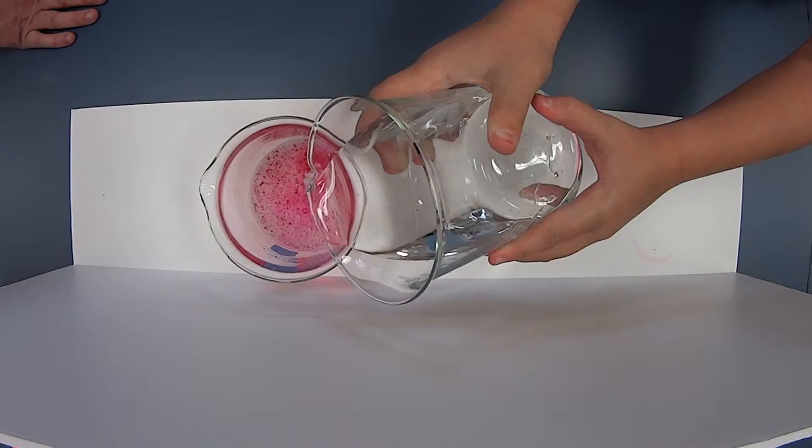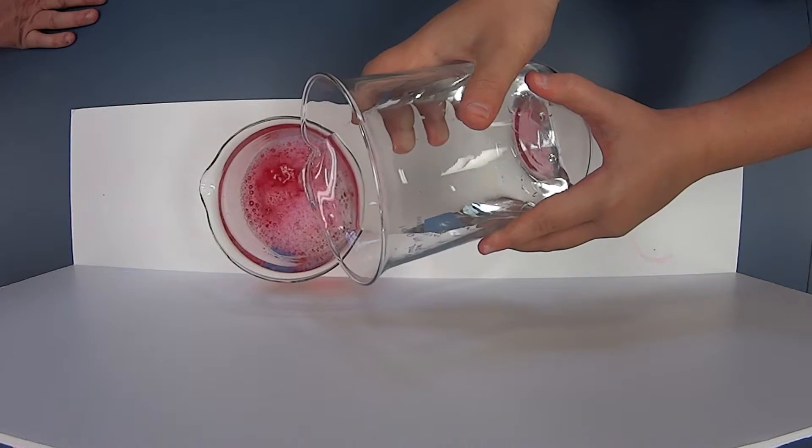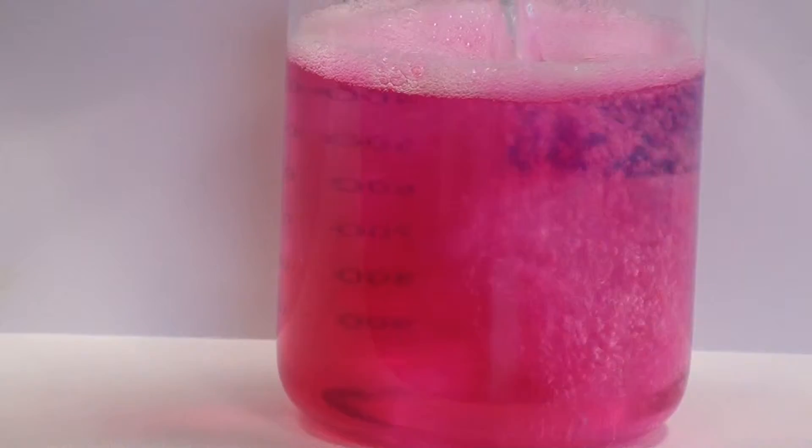So do we notice the color change taking place? Yes. Okay, it's turning pink. I just want you to keep pouring. Pour all of that in there.